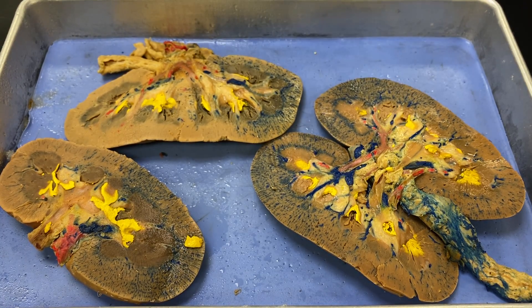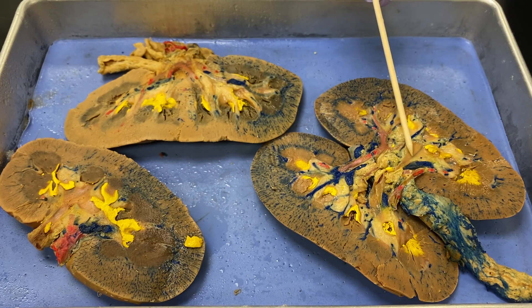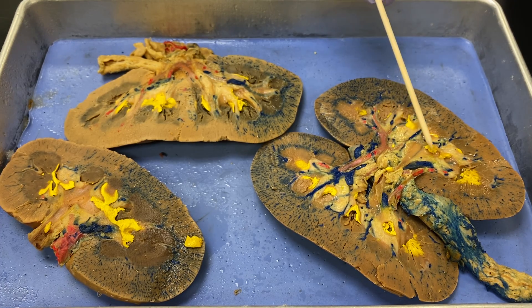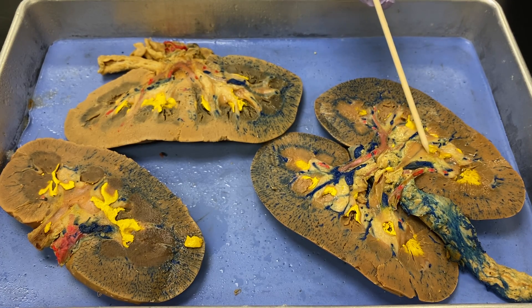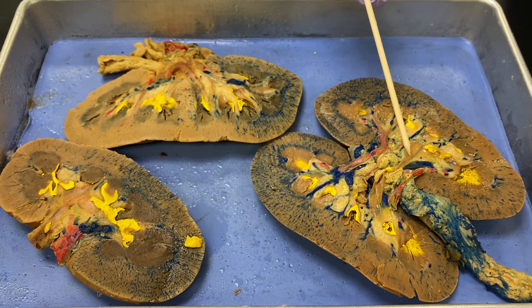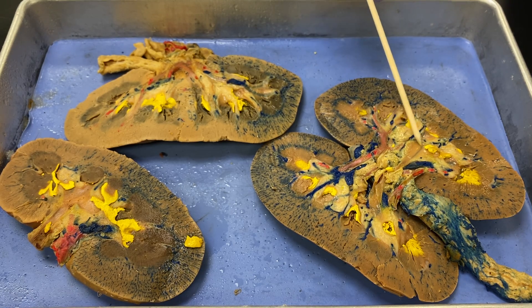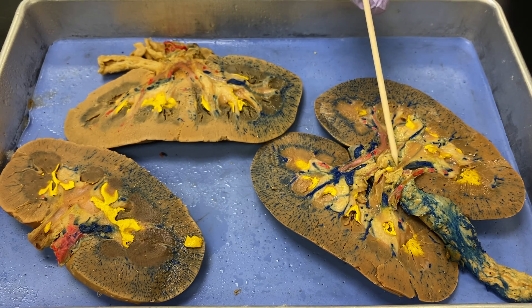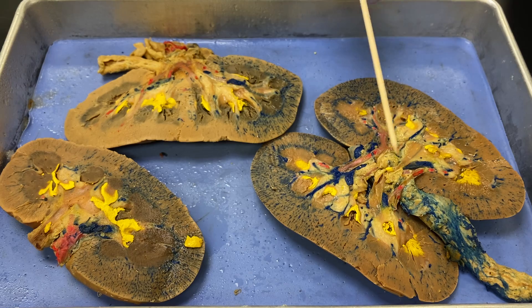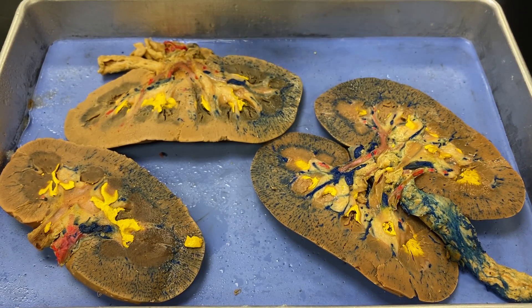You can see some indication of the calyces. This one is actually a calyx that has been split right down the middle. So I can see a minor calyx right there, and then this would be a major calyx in this region. The pelvis is down in here — it's been kind of chewed up, so you can't really see it, but you know where it is.